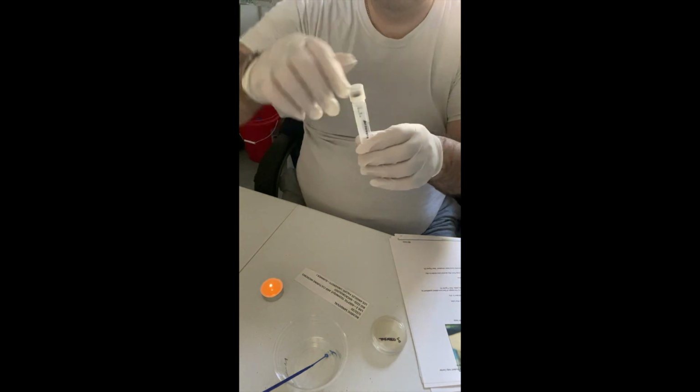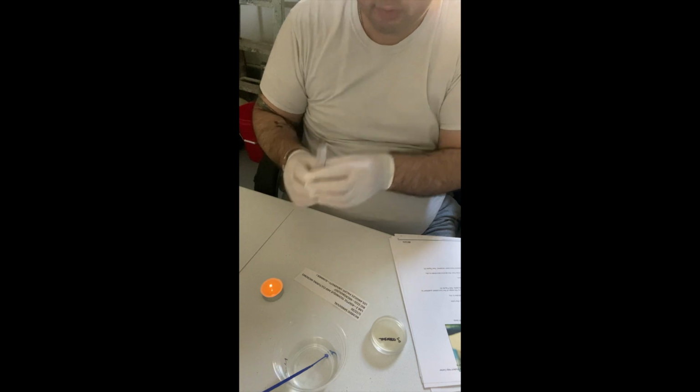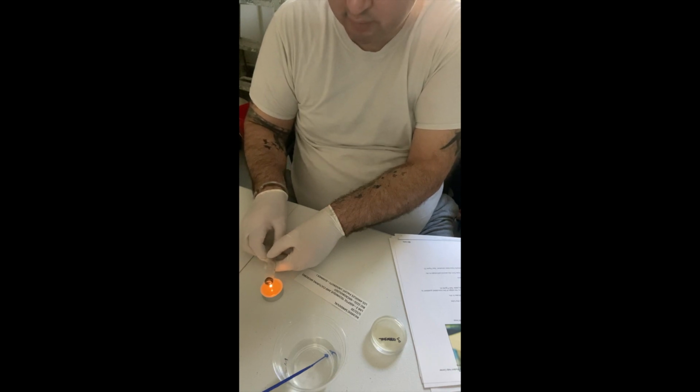Okay, so again, I'm going to remove the lid from the culture and then flame the tube here. And again, from the S. cerevisiae, and this I expect because yeast does ferment, a very pungent smell. I didn't really get much of a smell from the E. coli culture, but from the S. cerevisiae, yeah. And it very much smells like yeast, kind of like what it smells like when you're making bread dough. Okay, so that's flamed.